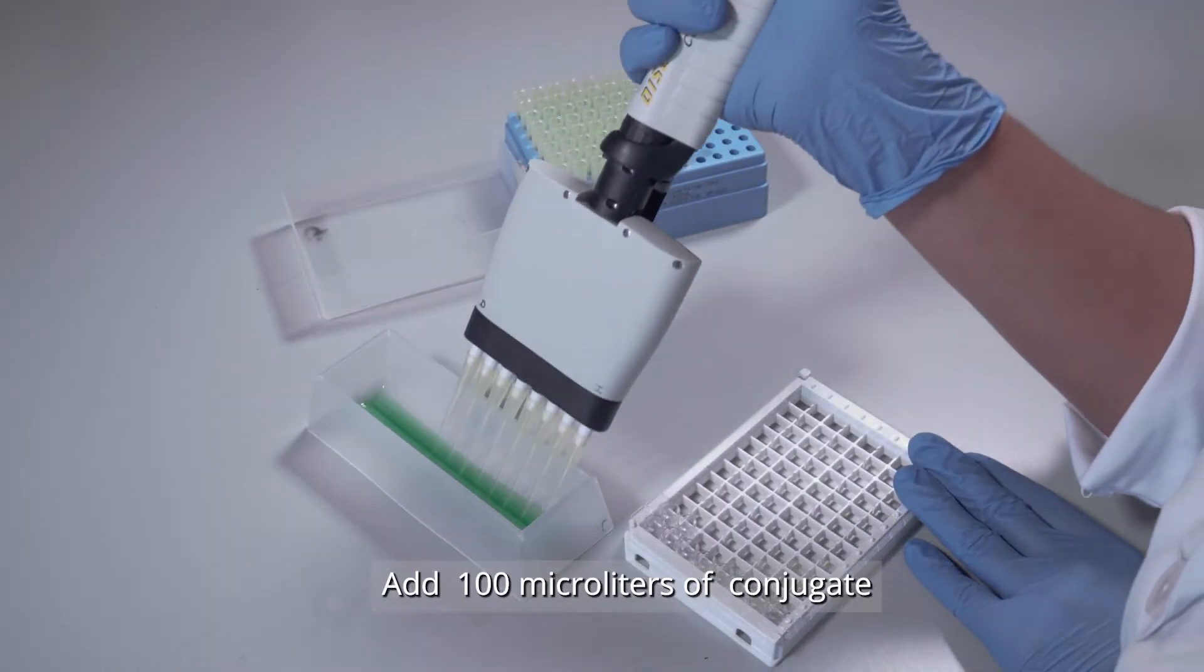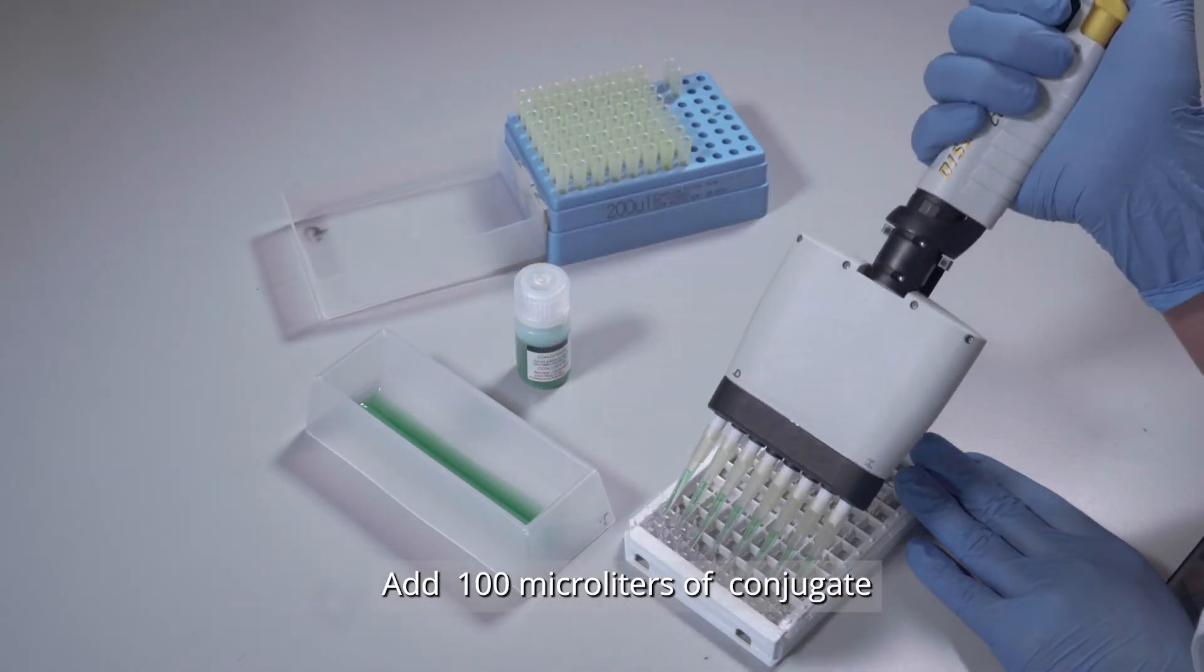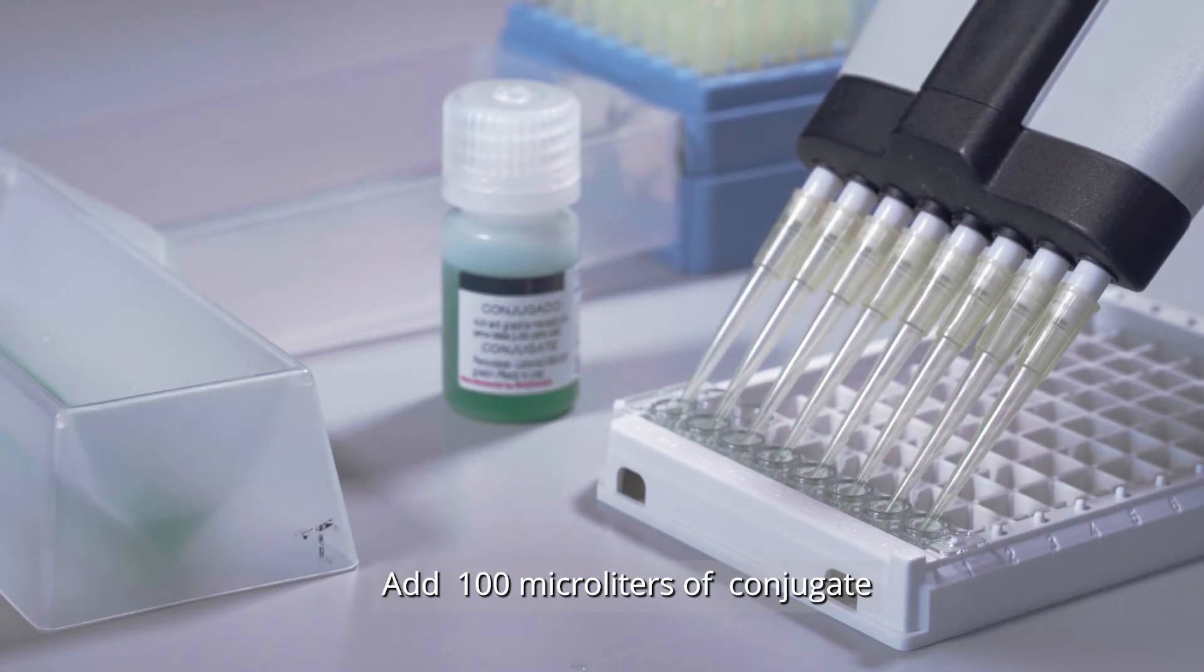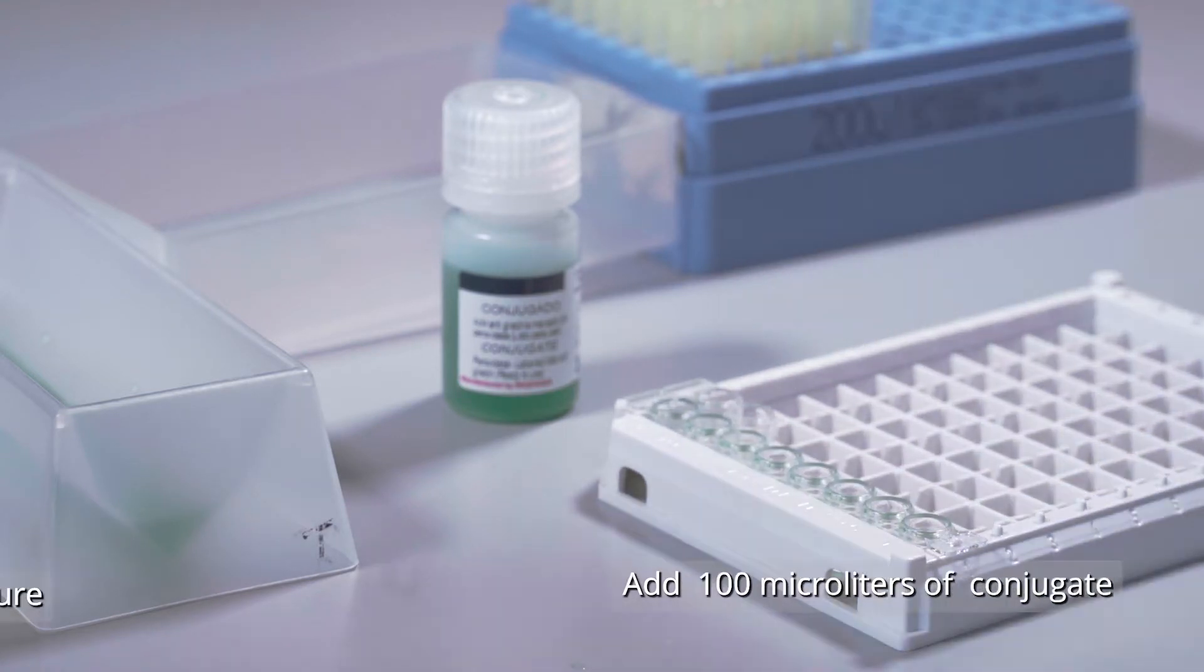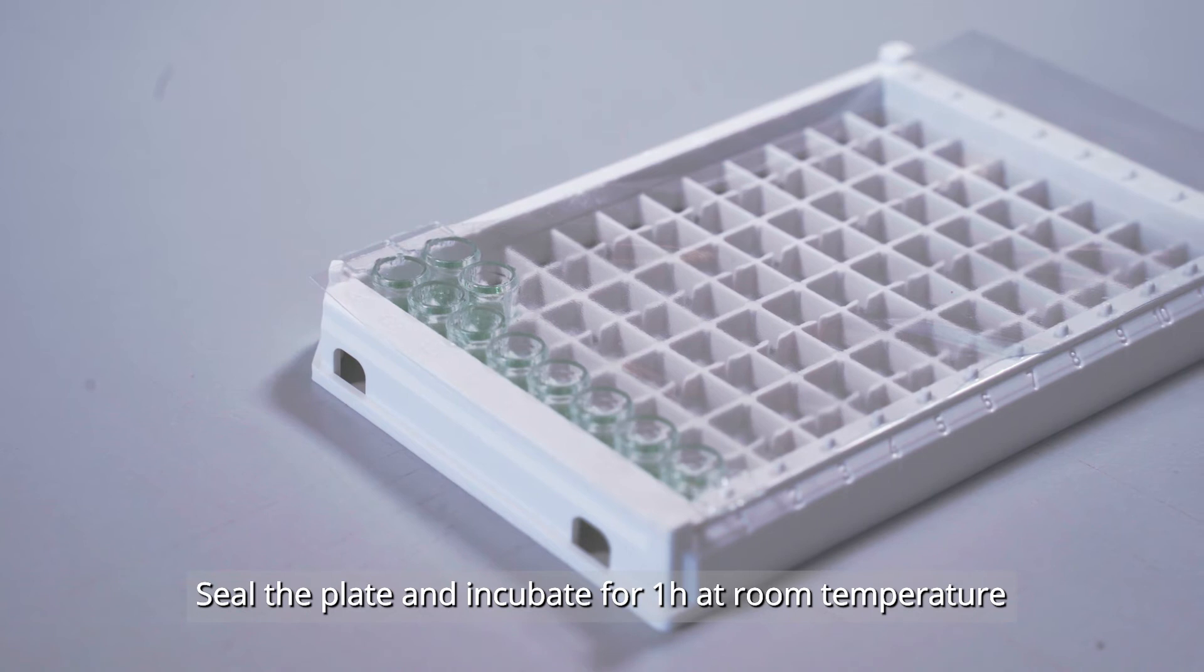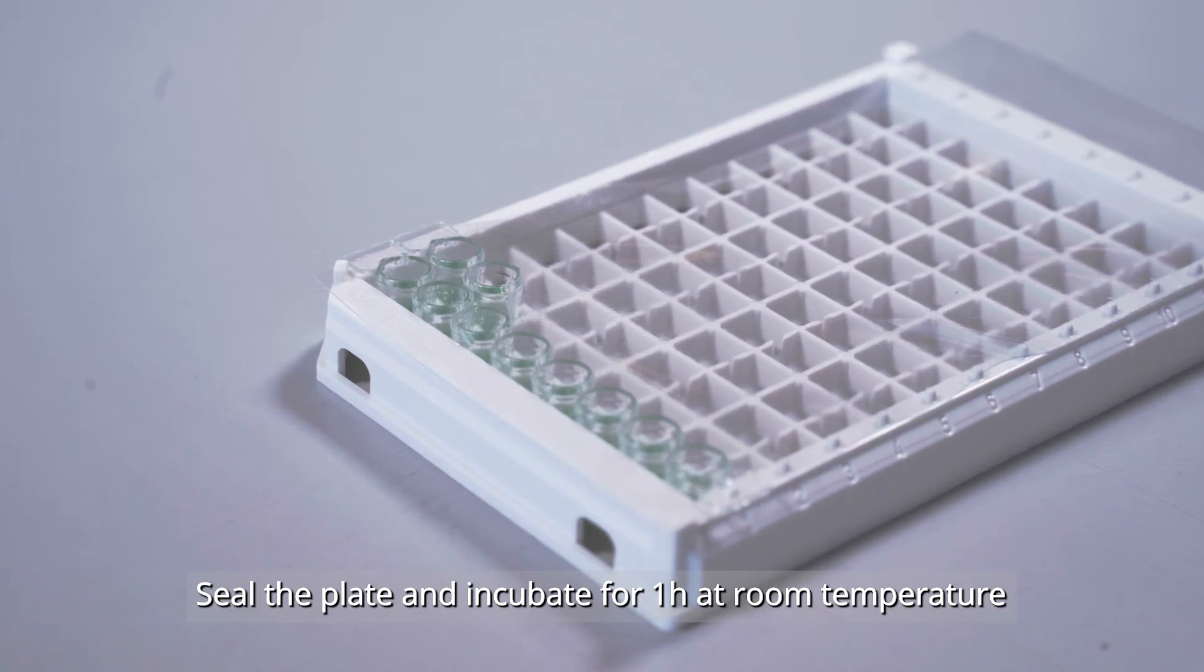Add 100 microliters of conjugate. Seal the plate and incubate one hour at room temperature.